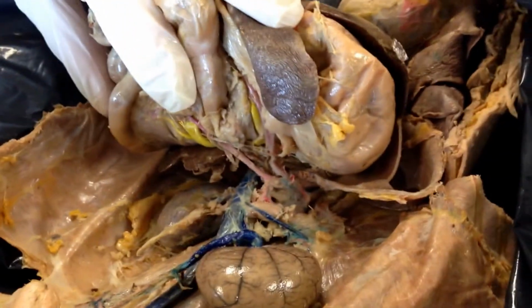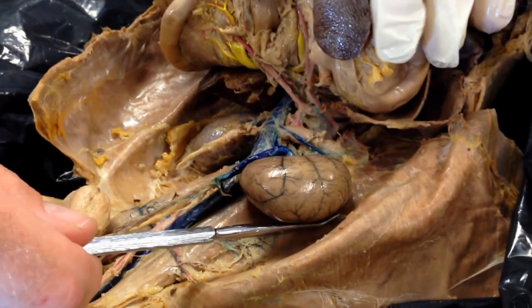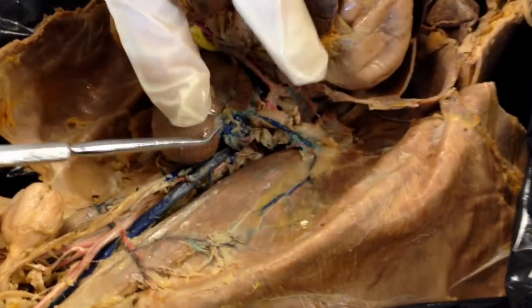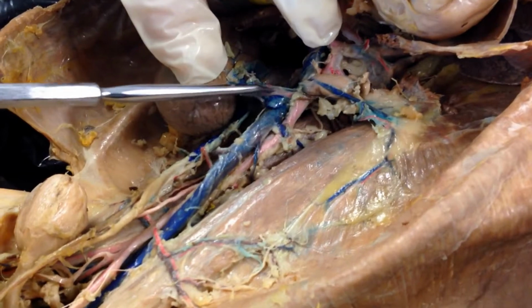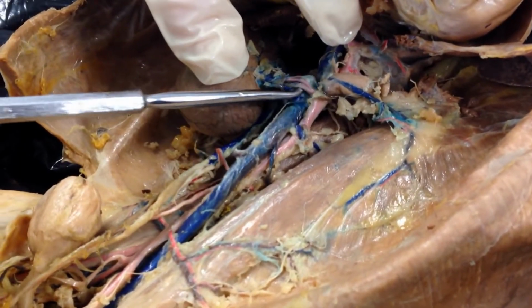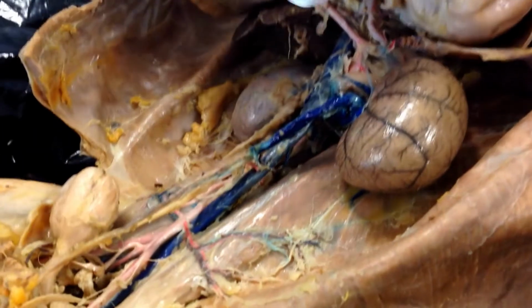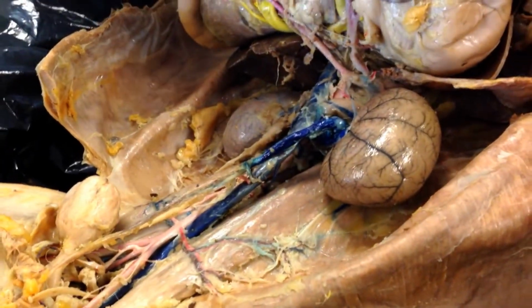The renal goes into the kidney, and the best way to see that is if you flip the kidney over. And then you can see the renal arteries, these two. There's actually two of them in here, which is a weird kind of setup, but we got two renal arteries going into this kidney. Usually there's just the one, and there'd be a matching one on the other side that we're not going to mess with.